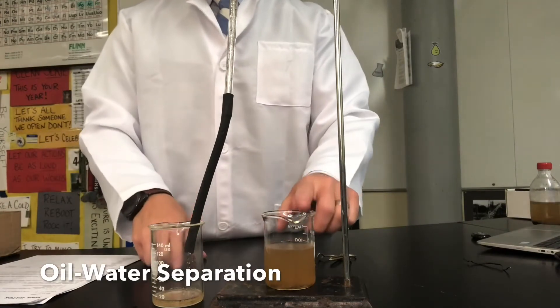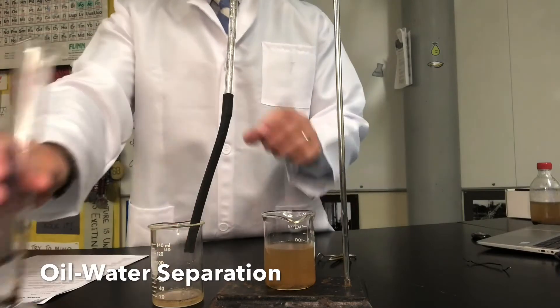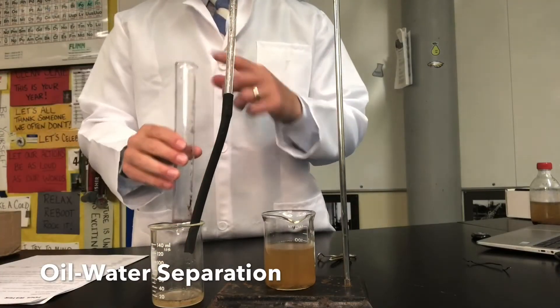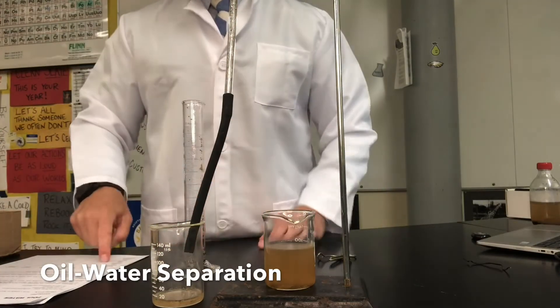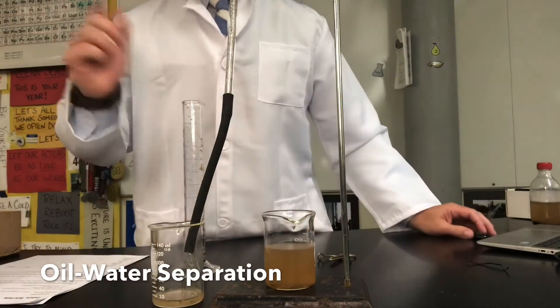All right I'm going to clean this part up and eventually distribute this slightly cleaner water back into a clean graduated cylinder so that we can take our next data point which is on how much water is left, so stay tuned.